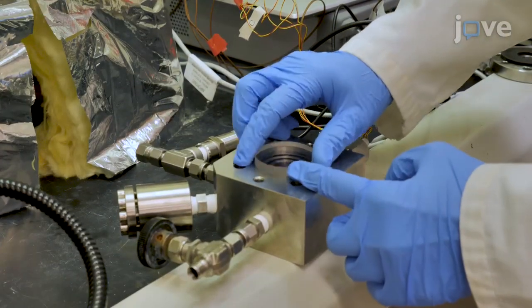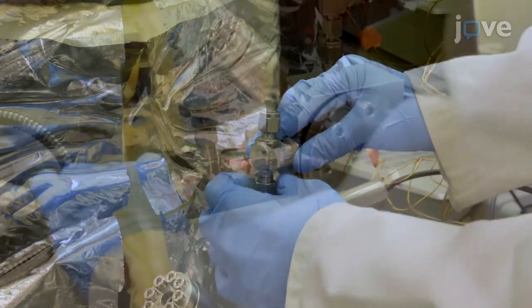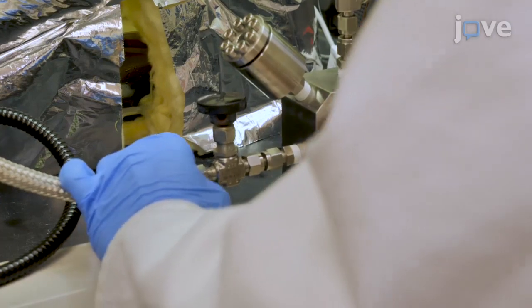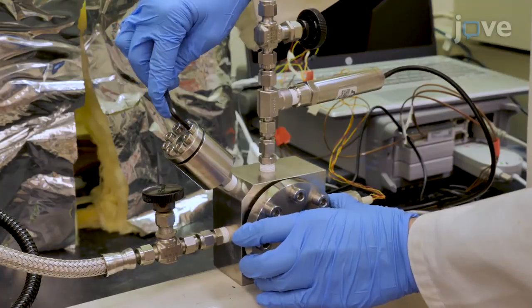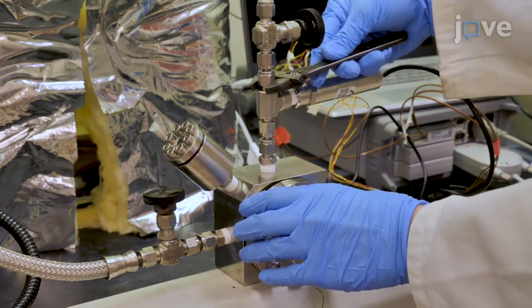Reattach the sapphire window and washers with M8 screws and attach top pressure cell valve. Connect the braided stainless steel hose from the pressure pump to the pressure cell and double check that all connections from the gas cylinder to the pressure cell are tight.